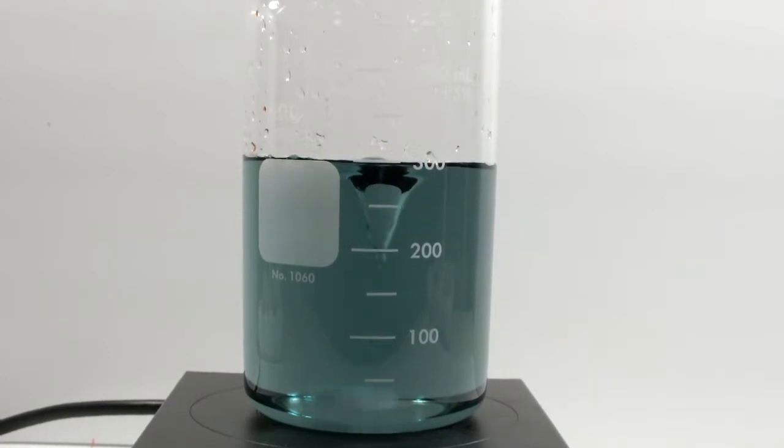When the oxidation part of the reaction slows down and it starts turning into a reducing environment, the ferroin should go to red and indicate that change. The process continues, and when all is said and done, we should have 4 distinct colors that oscillate in a regular pattern: green, blue, violet, red, and then back to green.